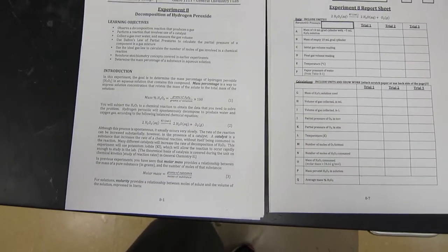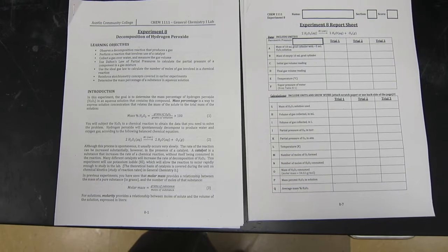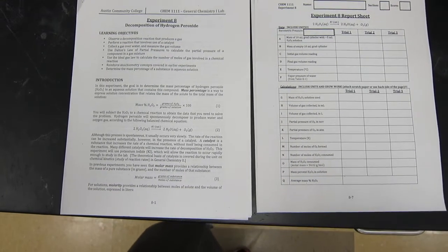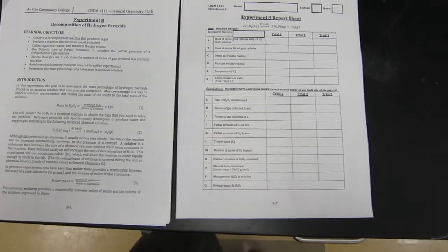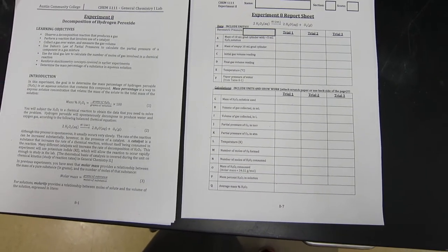Today we are going to do experiment eight. This is the decomposition of hydrogen peroxide. So we are going to do first trial and second trial for you.